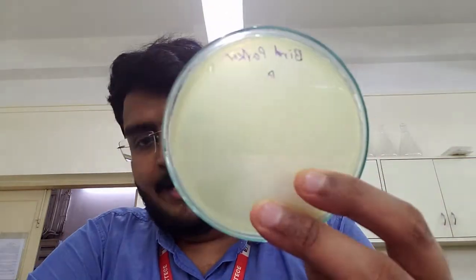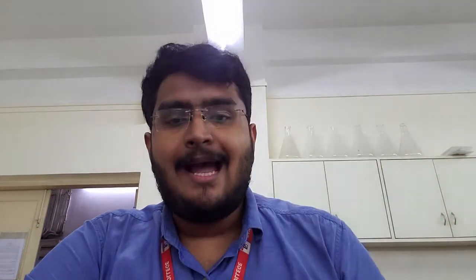The plate looks very opaque because of the addition of egg yolk. You can break a fresh egg yolk and make an emulsion, but that involves a high chance of contamination if not done in a sterile zone. That is why several companies provide egg yolk emulsion which also contains tellurite — you simply add a specific amount to the media depending on the volume you are preparing, without needing to add tellurite separately. This is how we prepare Baird-Parker's agar.